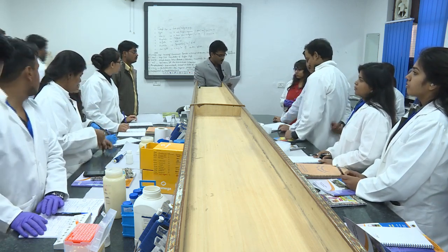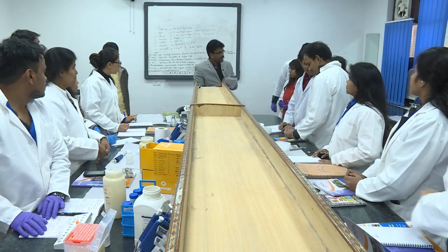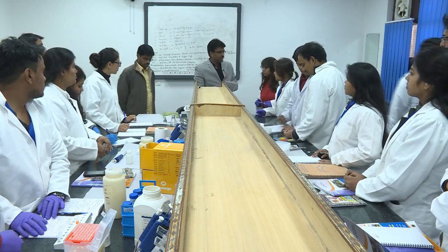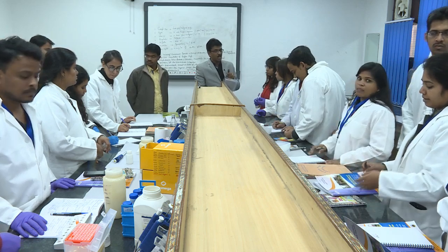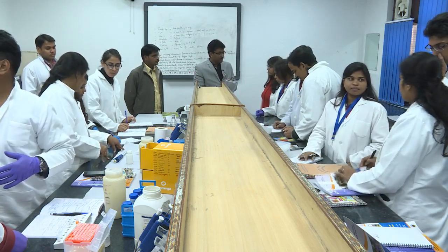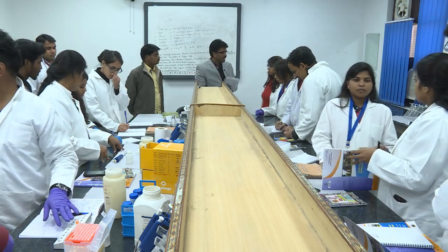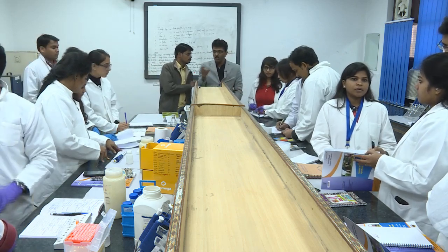So, that is expected also. Okay. Now, you go with the 100 nanograms per microliter working stock. Just sit and calculate how much stock you need to take and how much buffer you will add. So, the total becomes 50 microliter and the concentration becomes 100 nanograms per microliter. Do it now. That is true for the other groups also.